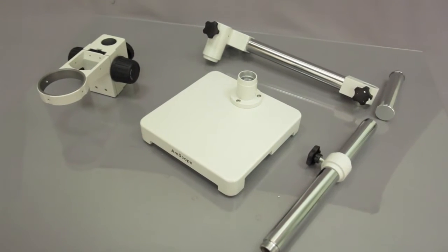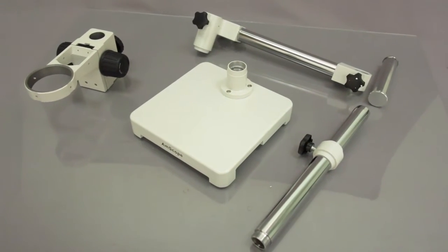All right guys, this video is going to show you how to attach the SAW, which is the single arm boom stand.